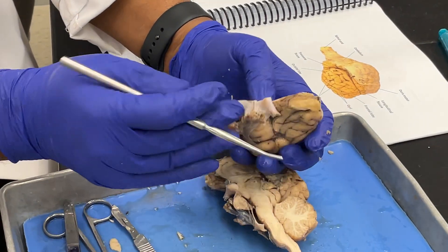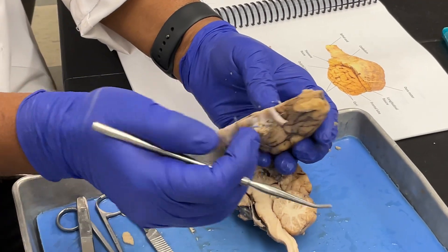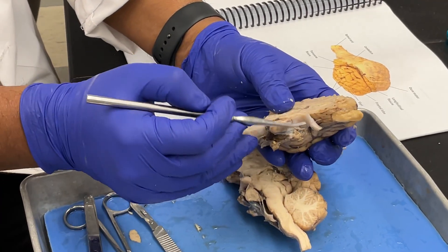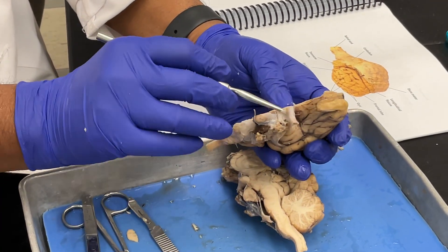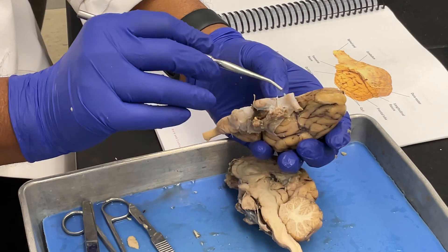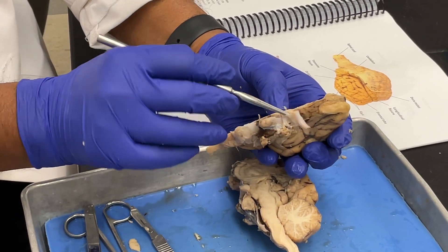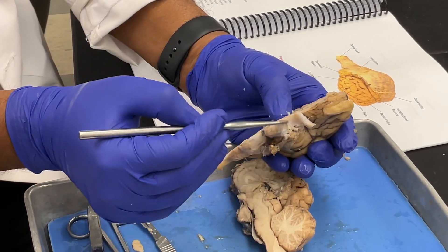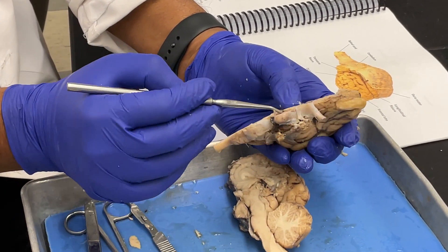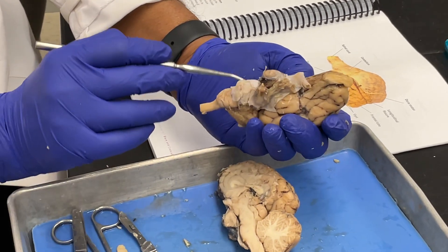If you take all this off you might pull out the optic chiasma, so we didn't remove it. You can cut a little bit here in between to expose it if you want, but you have to be careful because it will come off very quickly.